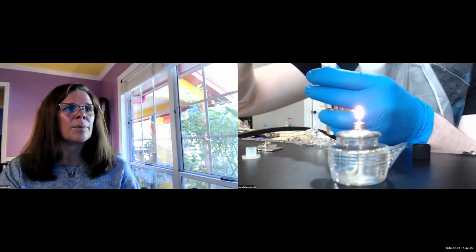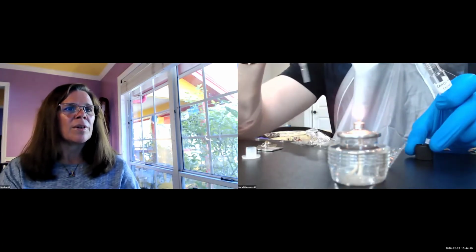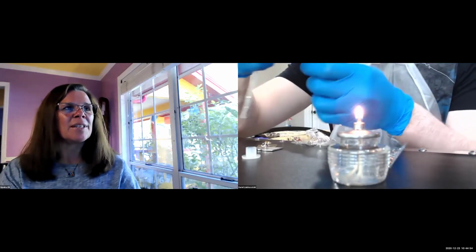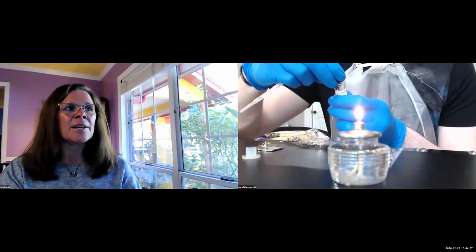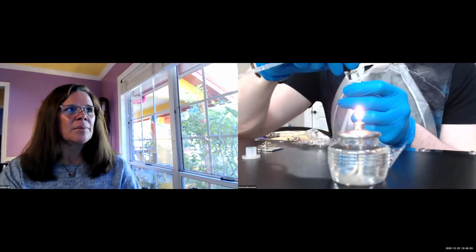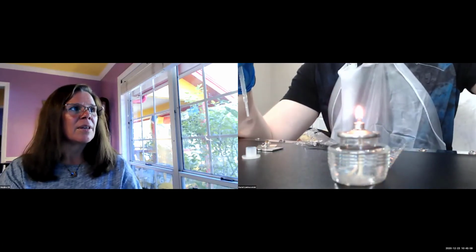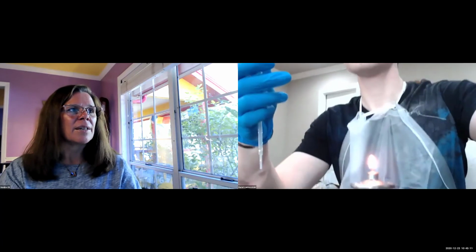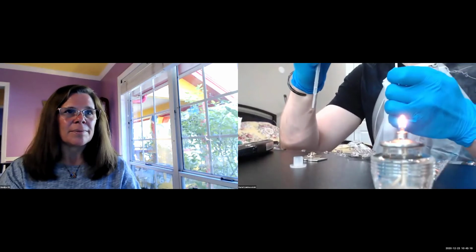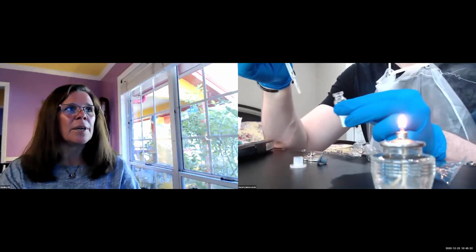Then pull it out and see if you can put the lid back on your liquid broth. Can you hold it a bit further down? Ideally you flame it again before you put the lid on it next time. Okay, and now you use your dehydrated culture. Let me angle this camera up just a bit so we can see more. And then take the plastic lid off.